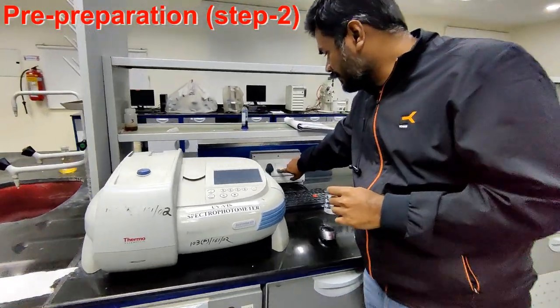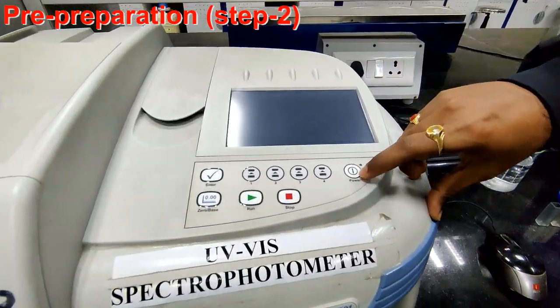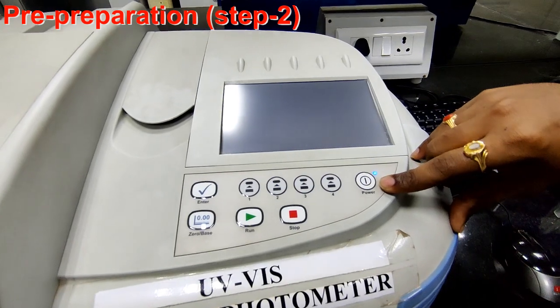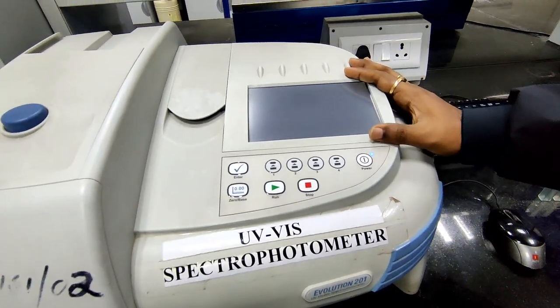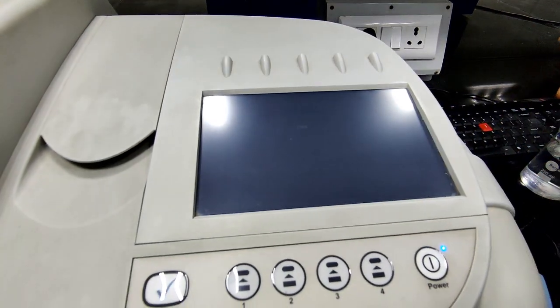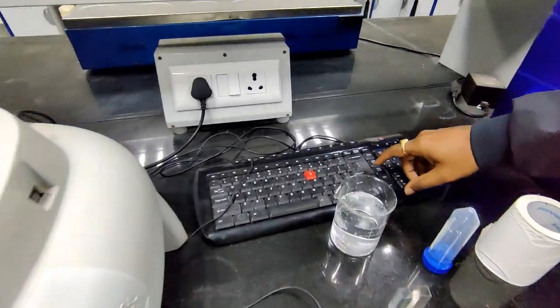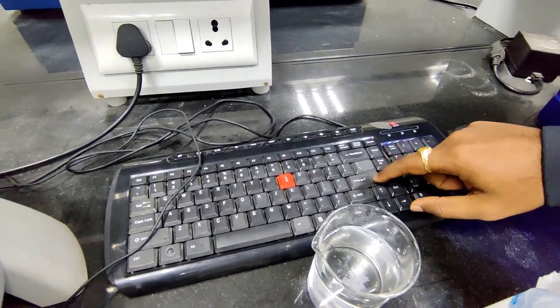We switch on the power supply, and after that we switch on this power button. Then we'll see that the LED screen lights up, and after that on this keyboard we press enter to proceed.